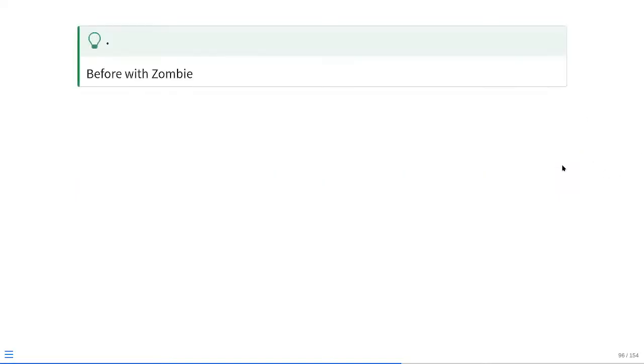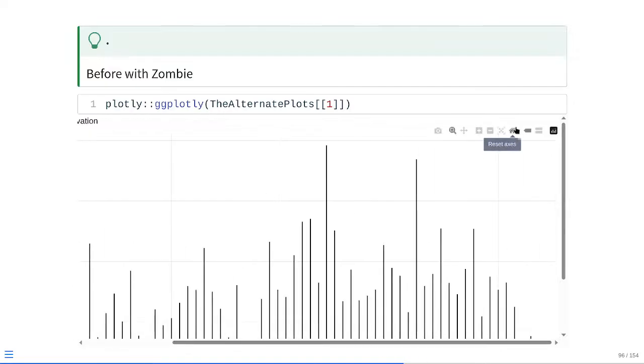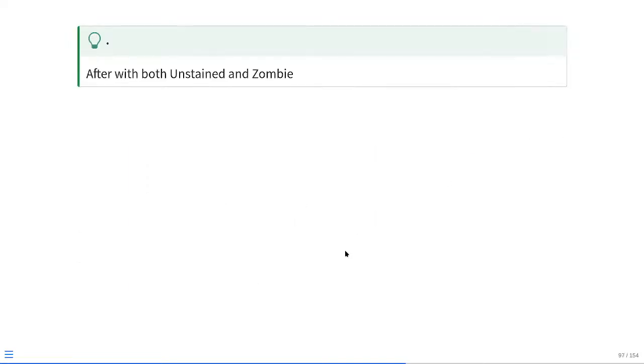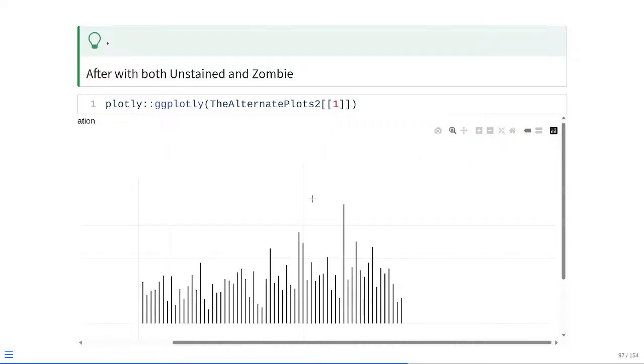At that point, we make sure this new updated data frame is being passed to signature data, and we can go ahead and rerun. And if you remember, when we did include zombie, we were just having some of those leftovers corresponding to the 6th detector at 800, 39 at 1176, 50 at 1106. But when we remember to include both unstained and zombie, if you look at our residual plots at that point, we still have this one over here at 50, but then 6 is substantially reduced, as well as the 39 one's a little bit down.